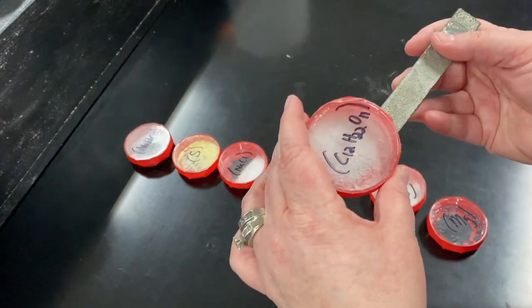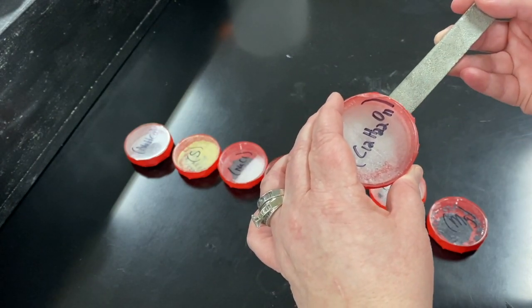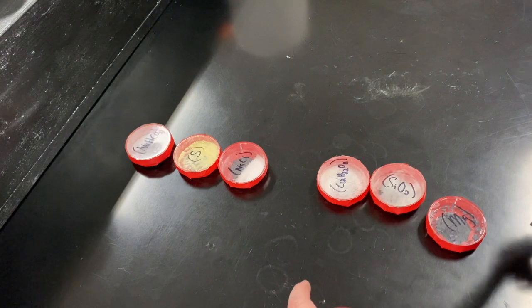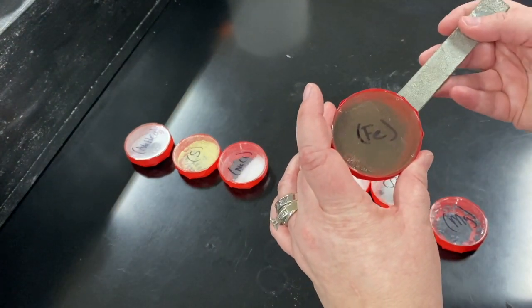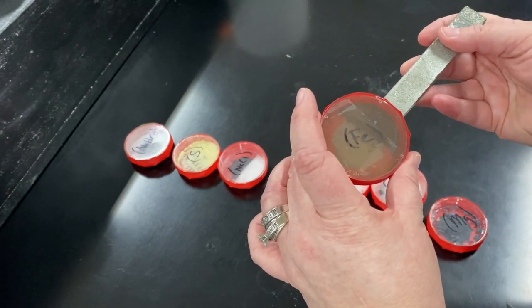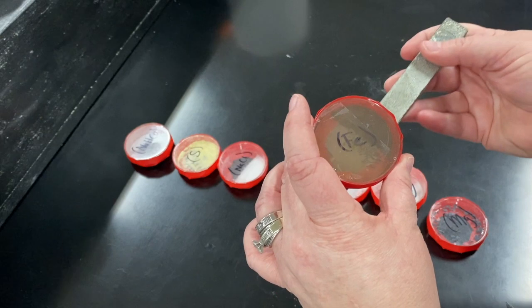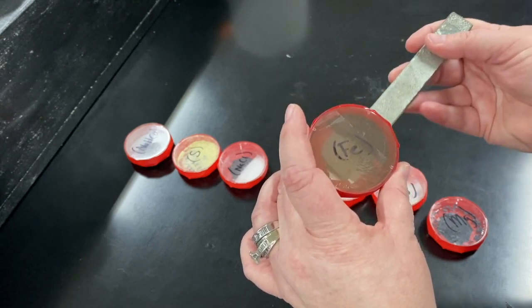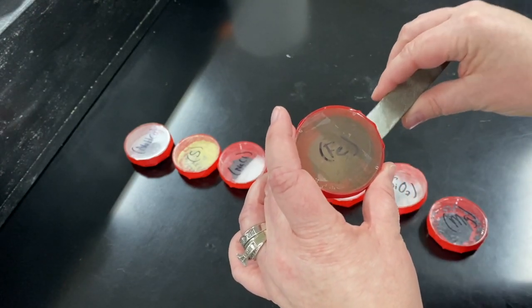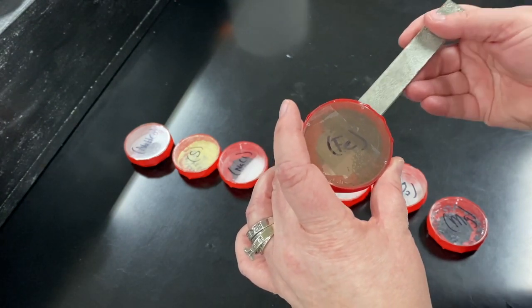For sugar, we're not seeing any movement. With the magnet, we're looking for a left-to-right-ish movement — not seeing anything there. For iron, you can see the iron. As I move the magnet, it starts to want to come with it — you can see it actually moving with the magnet. So iron is affected by the magnet. If I flip the magnet, it's going to go the other way. Iron is moving with the magnet.